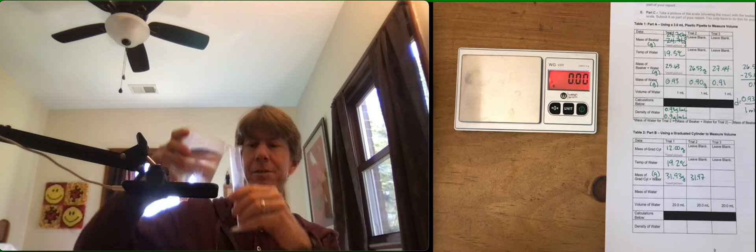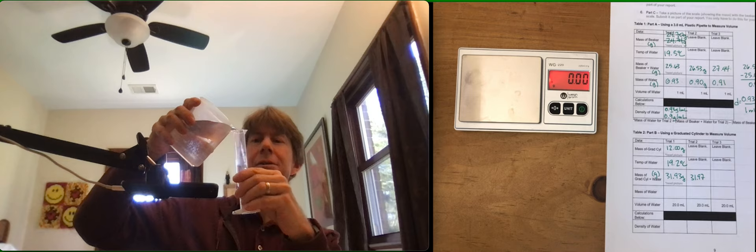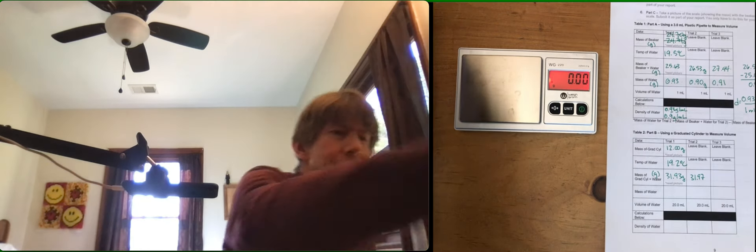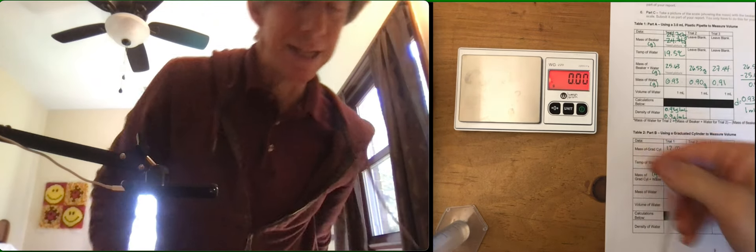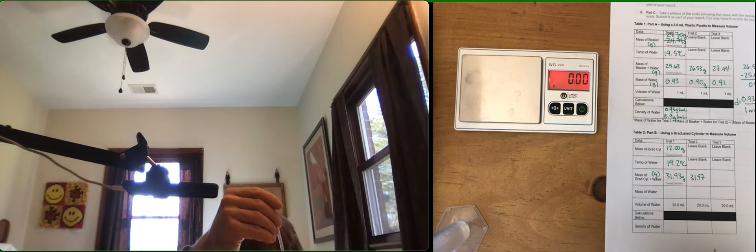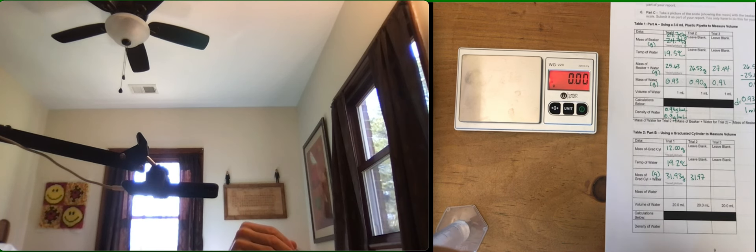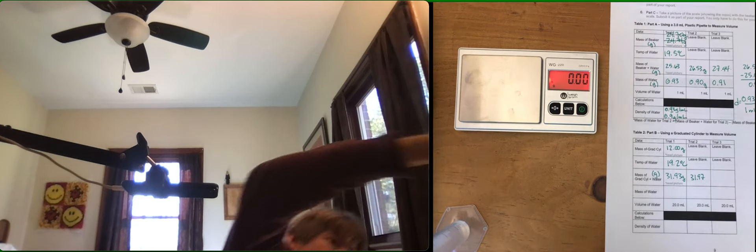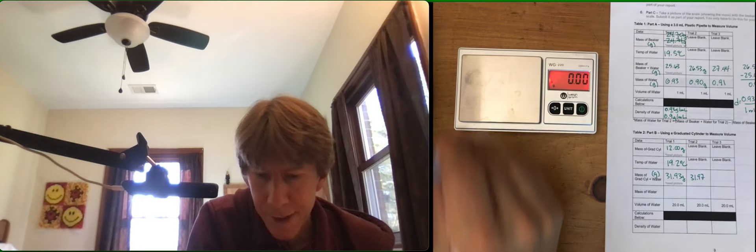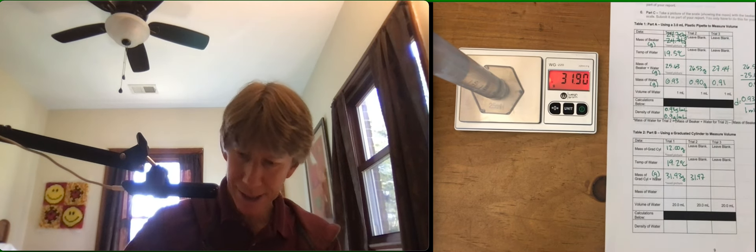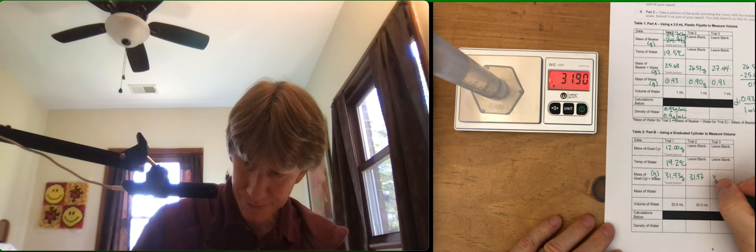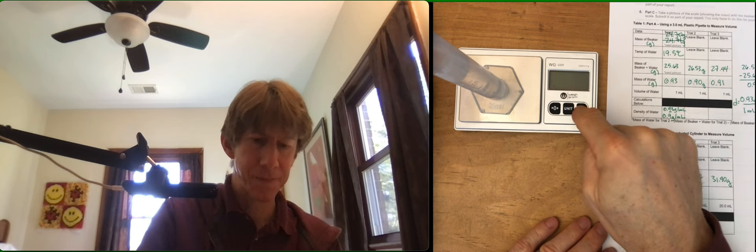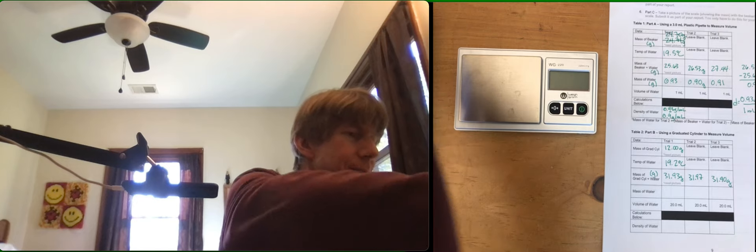Three times is the minimum number you need for a standard deviation, and that's what we're going for is a standard deviation. See, it really has to be set down on a level surface. I was going to try and do it while I was holding it up in the air, but that doesn't make any sense to do. And that's this one done. Pour that into the waste.